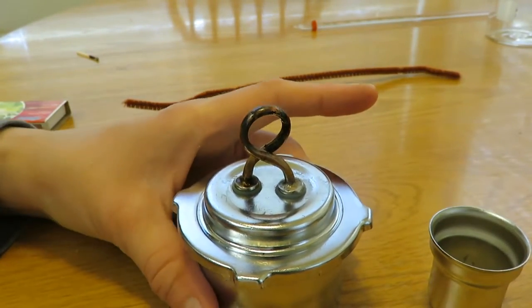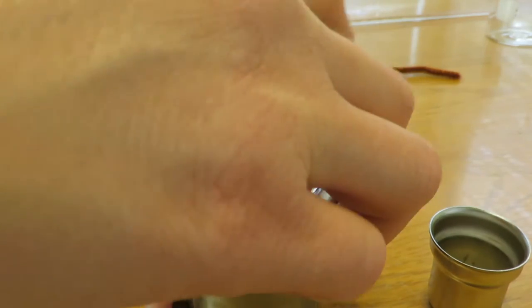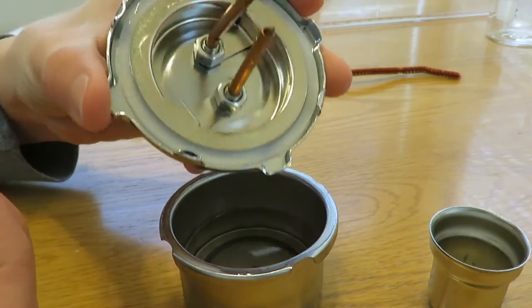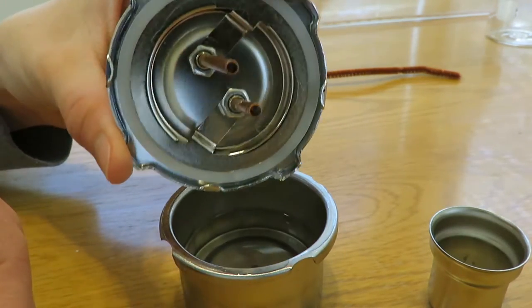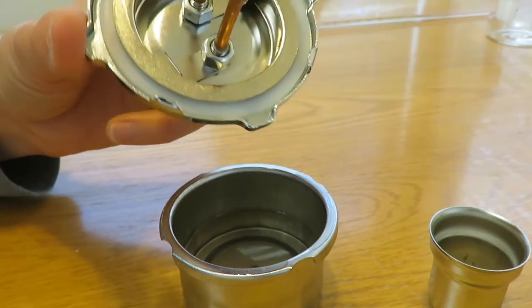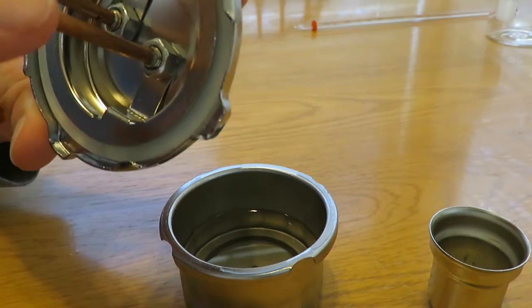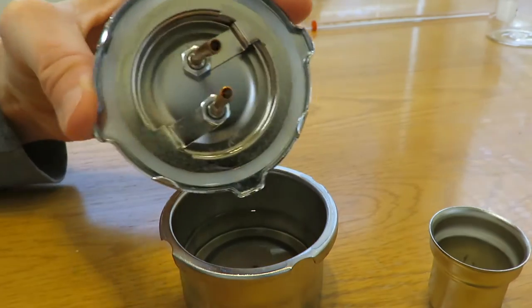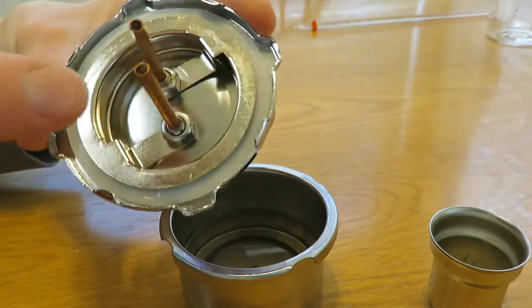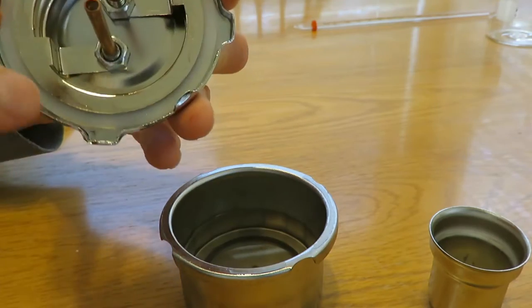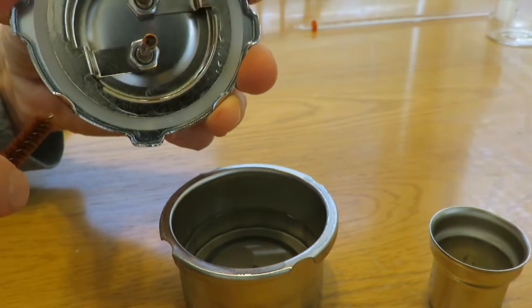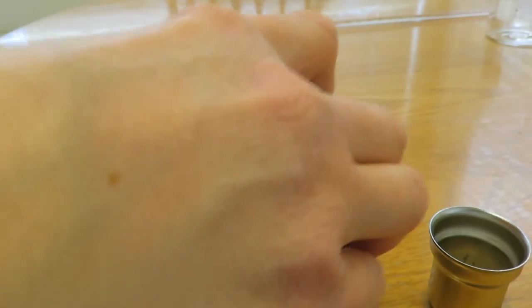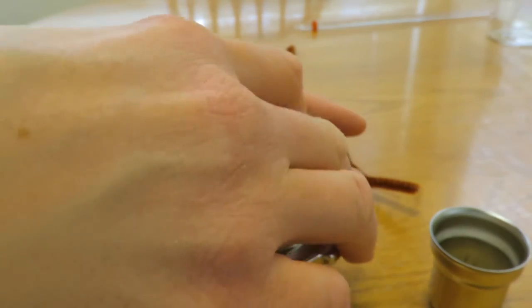I'll pop this open. I don't know, I guess they're talking about like here. I don't really know what they want me to clean with the wire. I guess it should be okay. I don't see where there should be any issues here, so I'm not even going to do anything. It looks like there's plenty of alcohol in here.